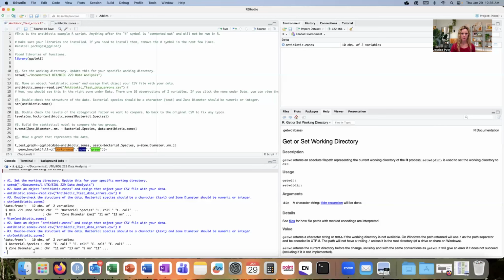My next column is called zone diameter, and it's also character type. Now this will be a problem because we can't do data analysis on character variables. We need to make sure that it's either an integer or a number. And I can see what the problem probably is right away based on this preview. I see 11 space MM, 13 space MM. So when this person entered data into the file, they included spaces and letters next to the measured number. That's why R imported it as a character type. If there's any spaces or letters, it will be imported as character type.